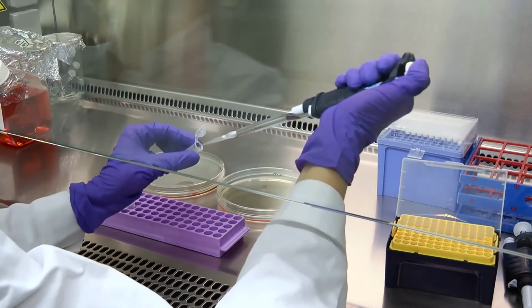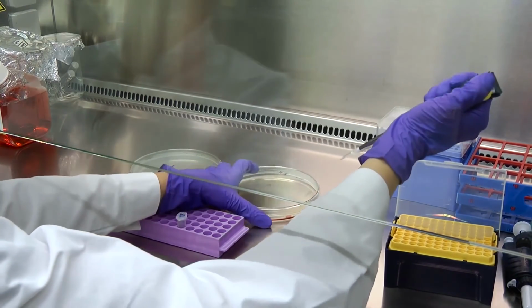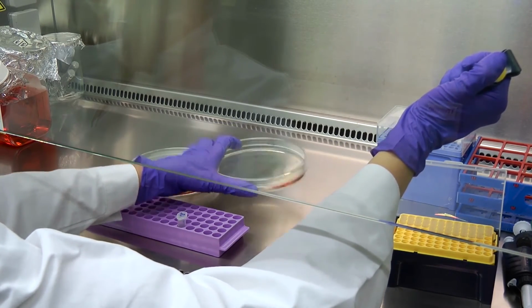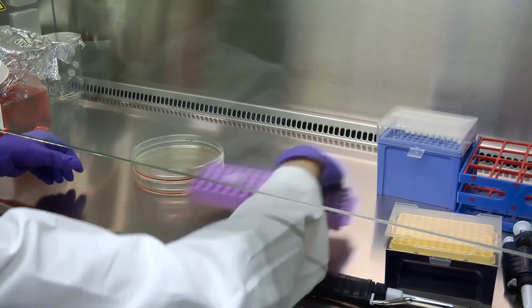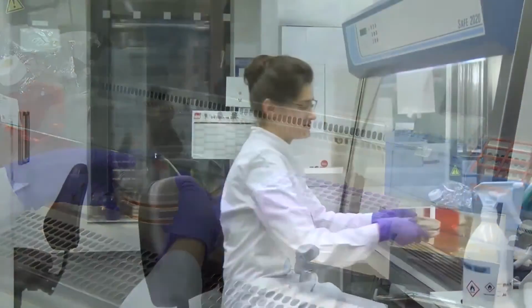And same with the other one. Now we'll leave the biology to do magic and put cells in the incubator where they feel warm and well cared for, for a few days, and then we see the results.